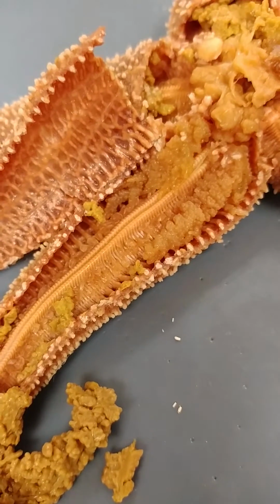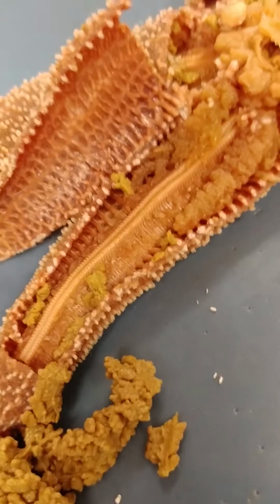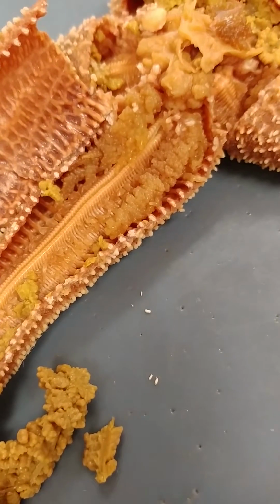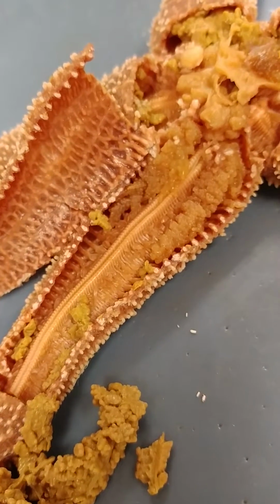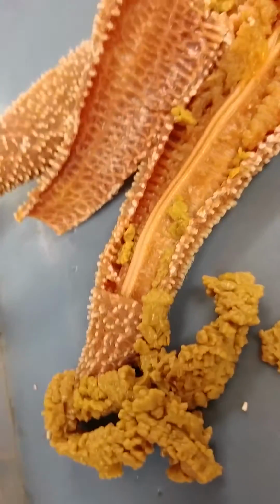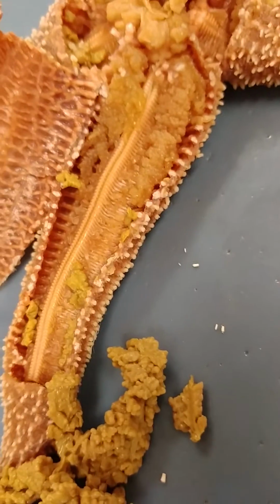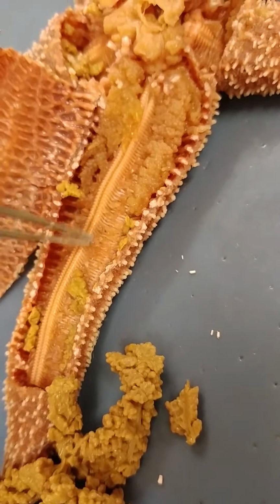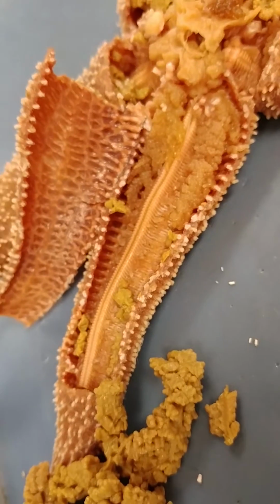What are those bubbles? Ampulla. So imagine something that looks like a pipette. So the bulb is the ampulla, and the tube feet are the tube in the pipette. Okay, so the ampulla actually can contract to push water into it and basically cause the little tube feet to extend. And then there's muscle to retract them. So that's what you're seeing. You're seeing a whole bunch of ampullae on top of those tube feet.